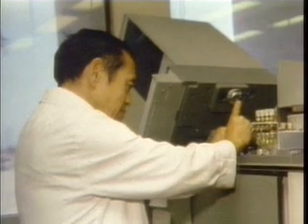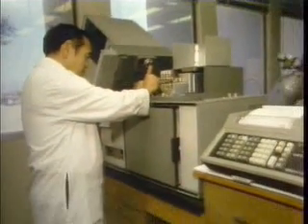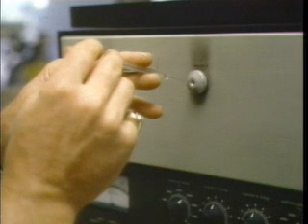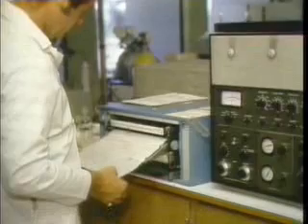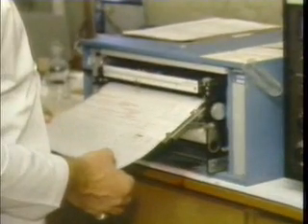When the sample removed from the ocean freighter arrives at the lab, it is prepared for analysis and then injected into a gas chromatograph, where it is immediately vaporized. The gaseous mixture is moved along the column by a carrier gas and separated into its components. Each component is detected as it leaves the column and its presence noted on a recorder.